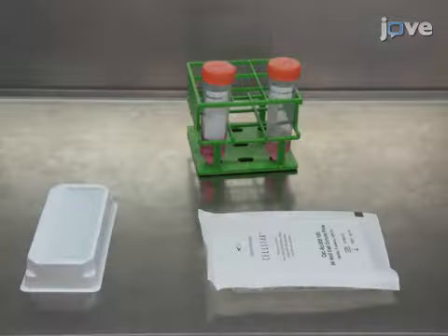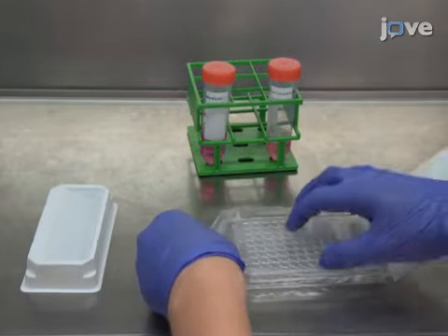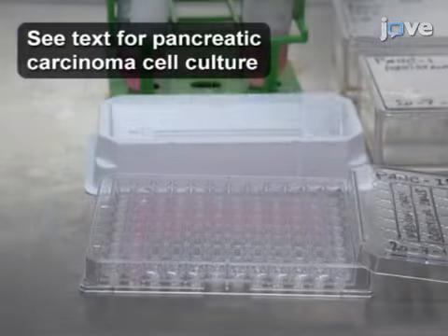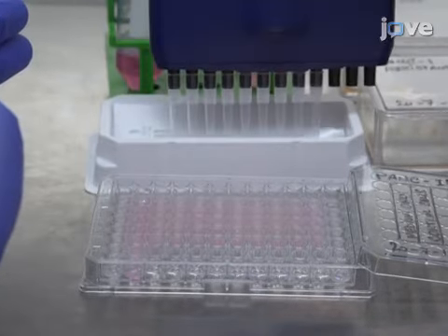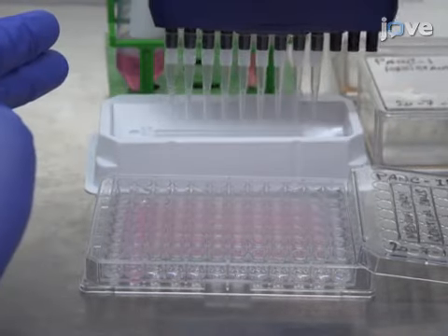To perform SRB assay for pancreatic carcinoma cells, prepare a 96-well flat-bottom experimental plate. Seed pancreatic carcinoma cells growing in exponential phase in triplicate in 96-well flat-bottom plates at the appropriate density in 100 microliters of medium by using a multi-channel pipette.